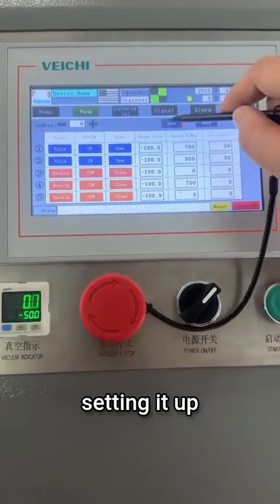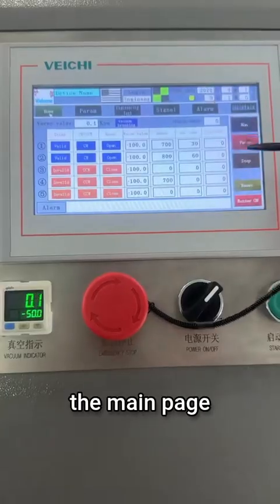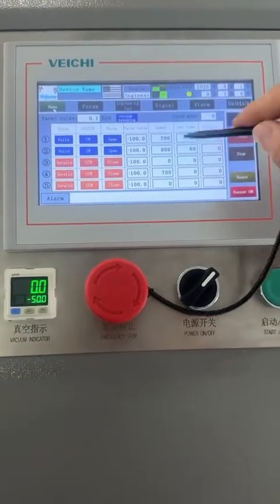After we finish setting it up, just click save, then click read here and you are done. Now we return to the main page and then we directly press one touch start. Then our machine can start.